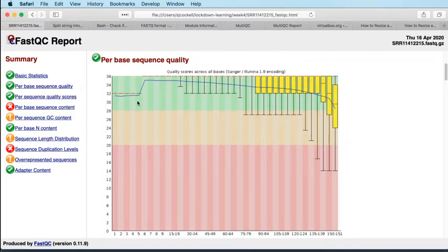So those discrete bins of quality are represented in this box plot, and then as we scan across the sequencing, you see that it starts at 32 and then jumps up to 36 after about 5 bases. That's very typical, and it's to do with calibrating the sequencer, and cluster finding in those early bases reduces the quality somewhat, but not too worrisome here.